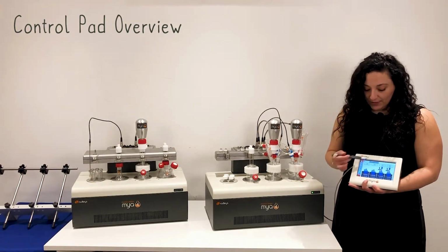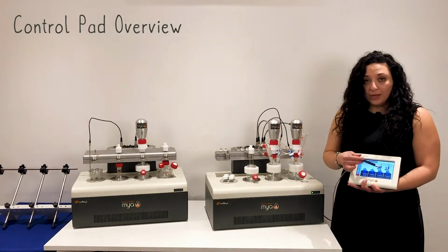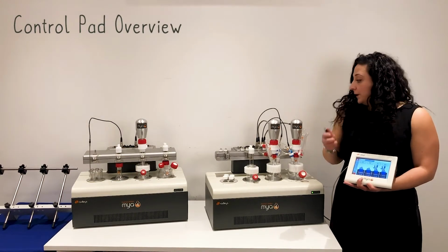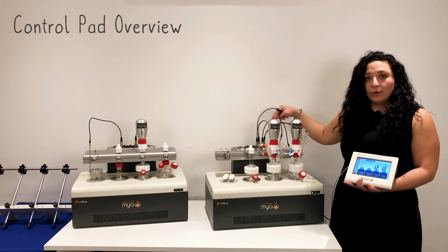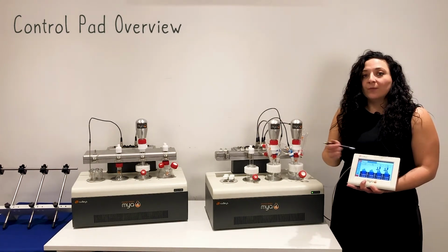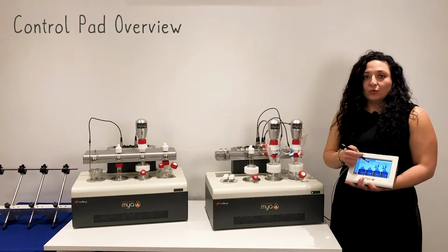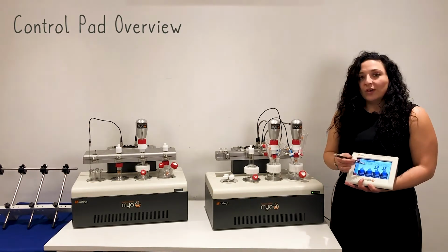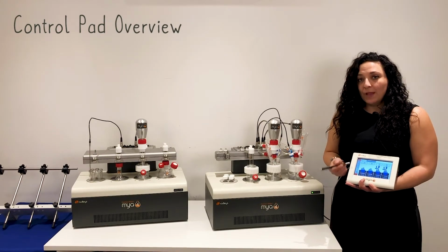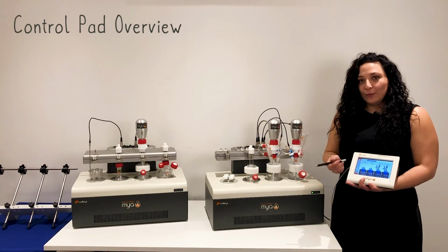As you can see, for example, here in zone 3 and 4, I've got a temperature probe depicted because I have temperature probes connected in zone 3 and 4. Same with overhead stirrers in zone 3 and 4. I've got them connected on here, and the control pad knows that. In other zones, it will show magnetic stirring by default. Let me show you the rest of the control pad in a bit more detail.